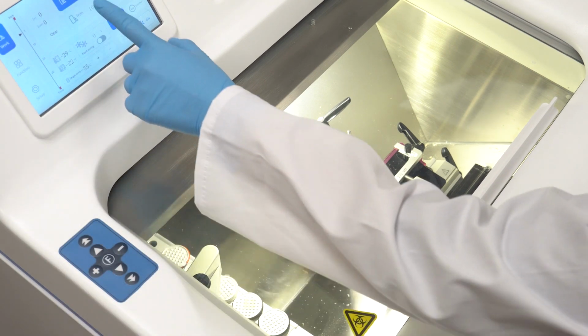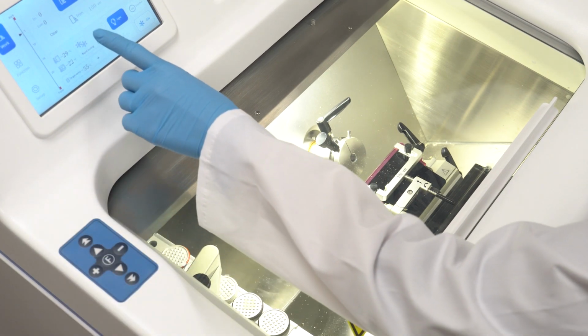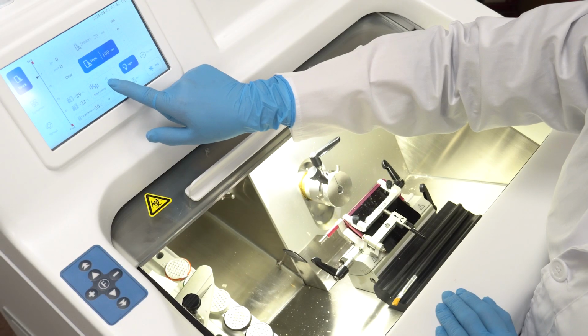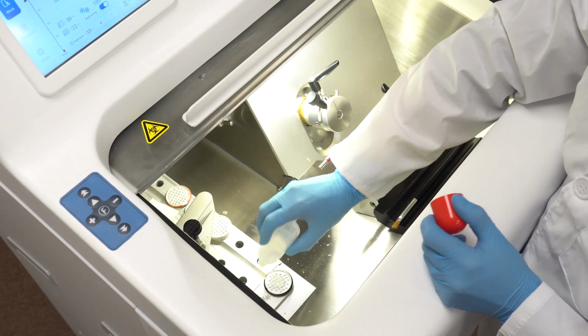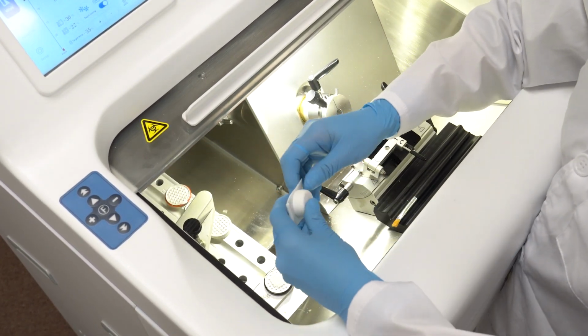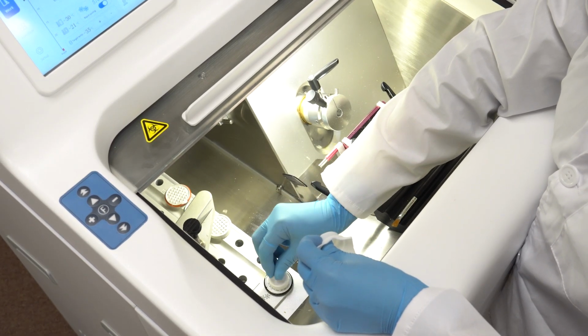Toggles between sectioning and trimming modes for precise control over the cutting process. Thickness adjust. Allows adjustment of trimming and sectioning thickness values to achieve desired results. Once your sample is embedded, it's time to orient and adjust it on the specimen head clamp. Carefully position the sample to achieve the desired sectioning angle and adjust the clamp to securely hold it in place.